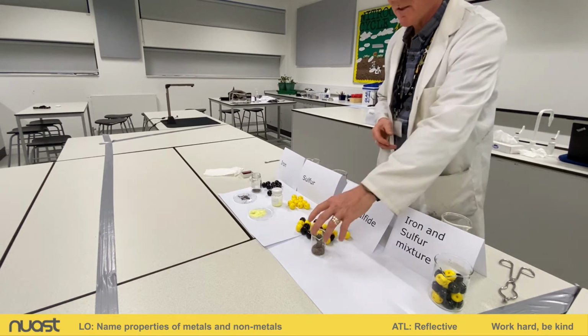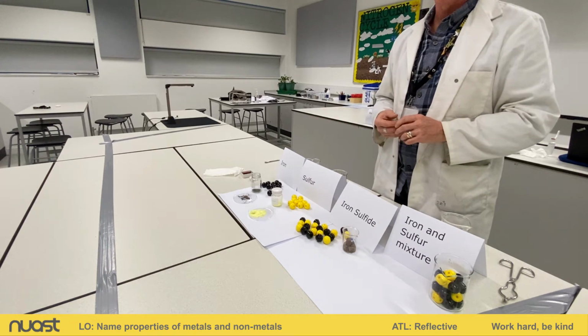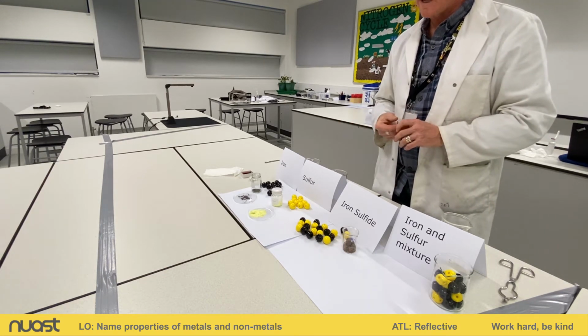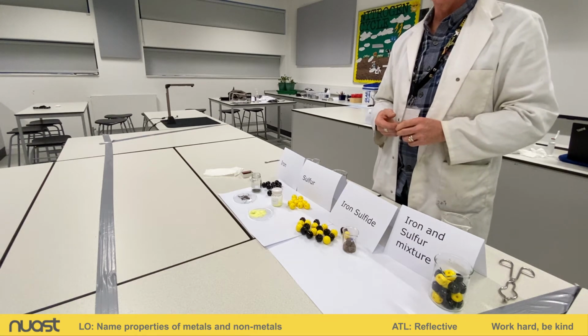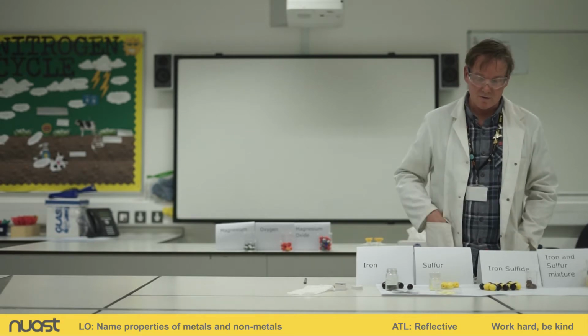So again, this is another bit of evidence to show that compounds and elements have different properties. And here you can see that these 3 substances have got different properties. There are other things that you can test to see the differences as well. In the last video, I burnt oxygen and magnesium, tested them with a circuit to see which one conducted electricity. And the magnesium conducted electricity, the oxygen didn't, and neither did the magnesium oxide. And we could do the similar sort of things with the iron, the sulfur, and the iron sulfide.